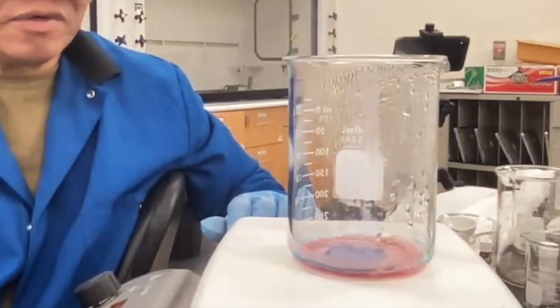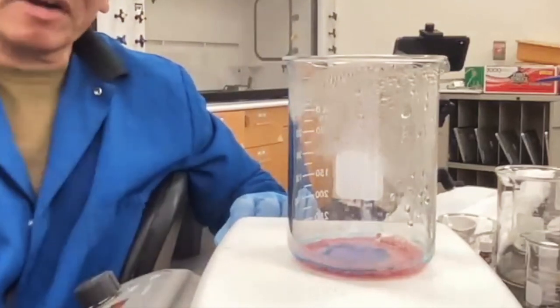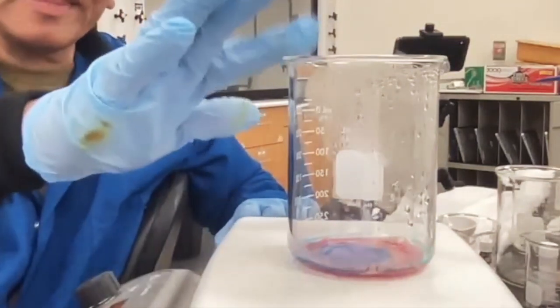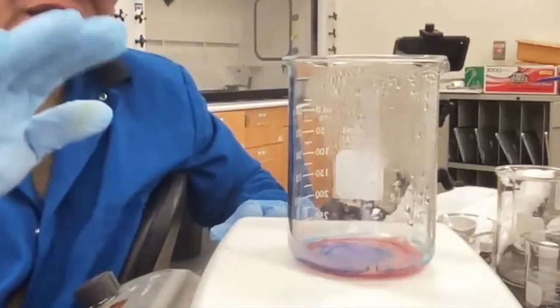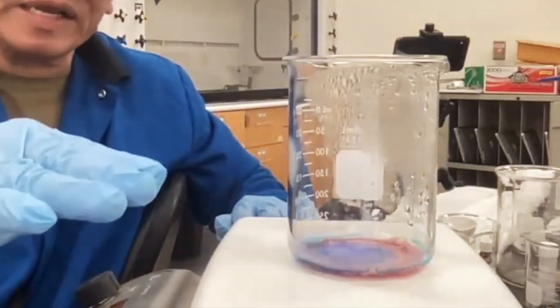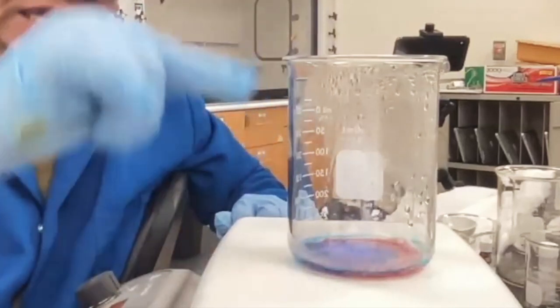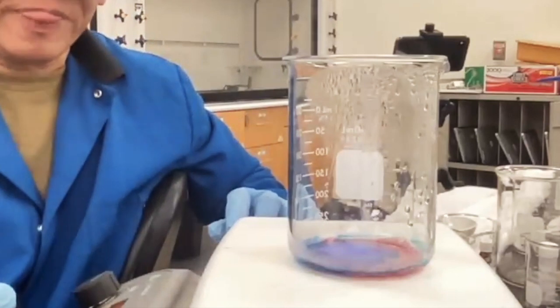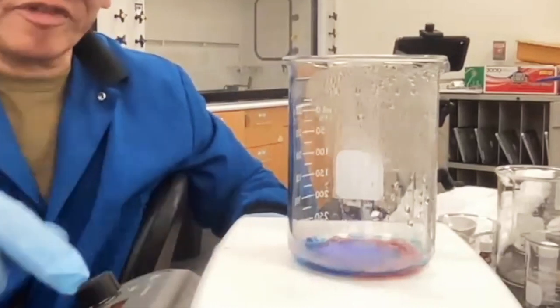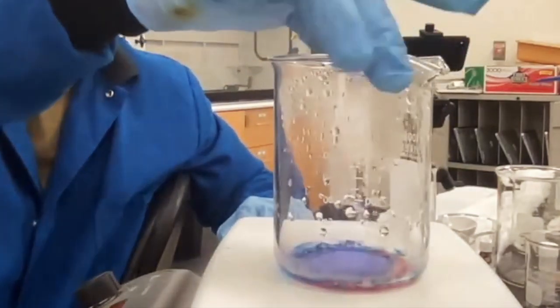Okay, that's all you really need to do, because if it's bone dry, there's nothing there, then you start heating up the beaker. The heat is not going to be transferred to the water anymore. Right now, the beaker is hot, but it's not that hot because all the energy from the hot plate is going to boil the water. That's where the energy is dissipating. If there's no water there, then that heat is going to transfer to the beaker. And when you get the beaker too hot, then it's going to fracture. So again, I just turn off the hot plate and I allow the natural heat from the hot plate to evaporate the residual water. And I think I put that in the directions as well.